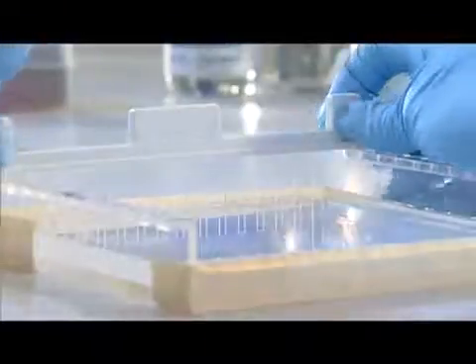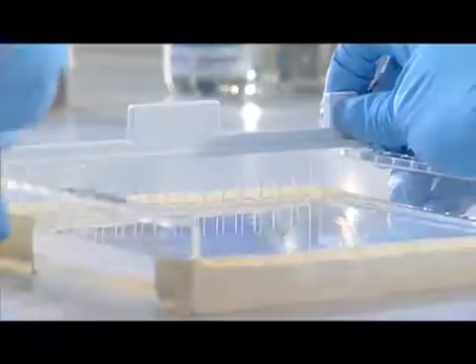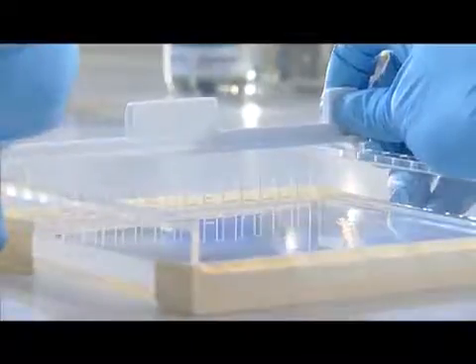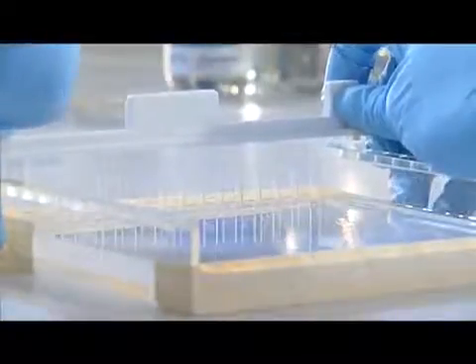Once the gel is set, you can remove the comb. Slowly and carefully pull the comb upwards vertically. You'll feel some resistance as the comb comes out of the gel. Then remove the masking tape from the ends of the gel tray.